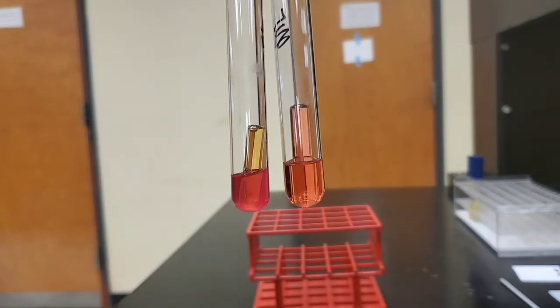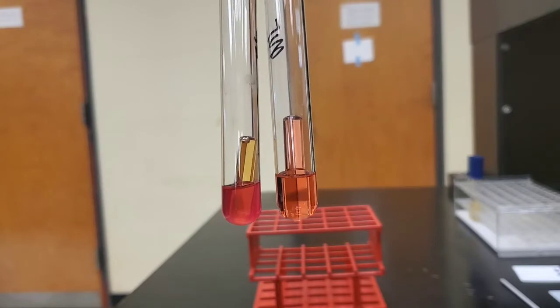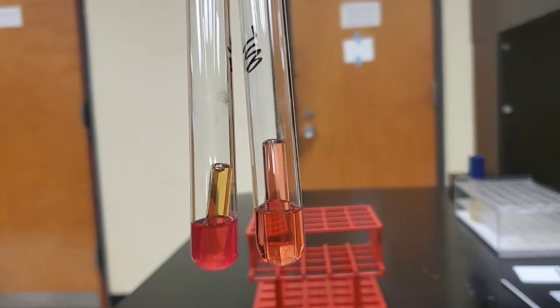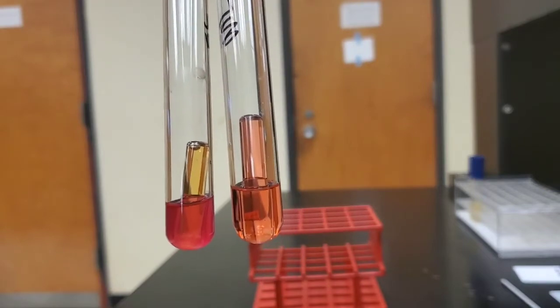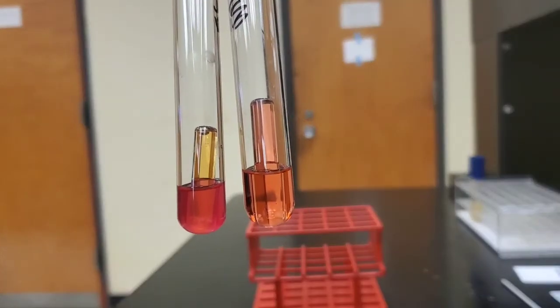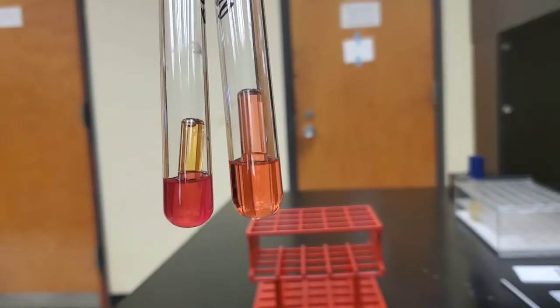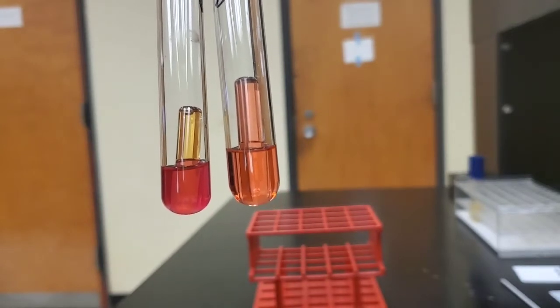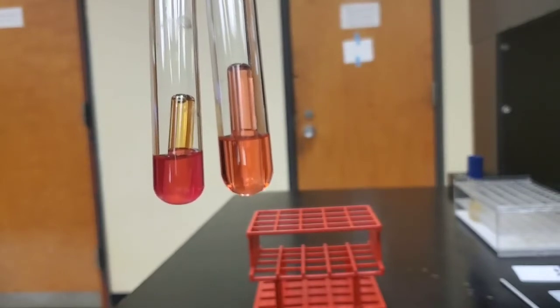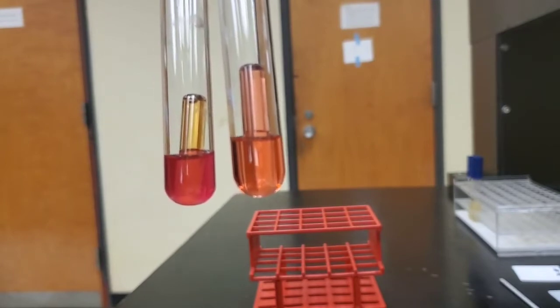On the left-hand side, we see that the liquid in the Durham tube has turned yellow and that there is a bubble present. So this is our E. coli, whereas in our Micrococcus luteus, the broth has not changed color and there is no bubble in the Durham tube. So our Escherichia coli, as indicated, was positive for the ability to ferment this substrate, as indicated by the color of the phenol red broth in the tube.